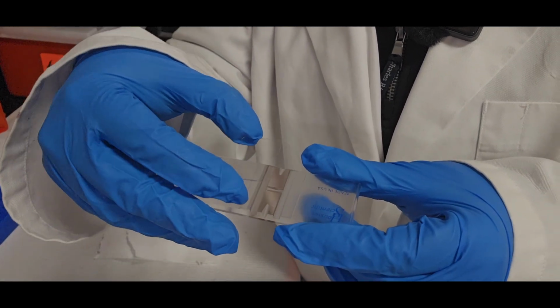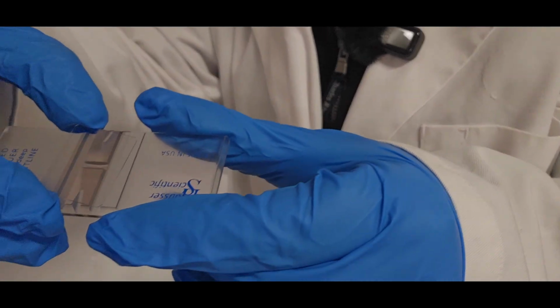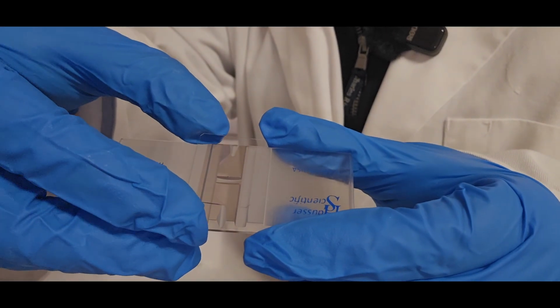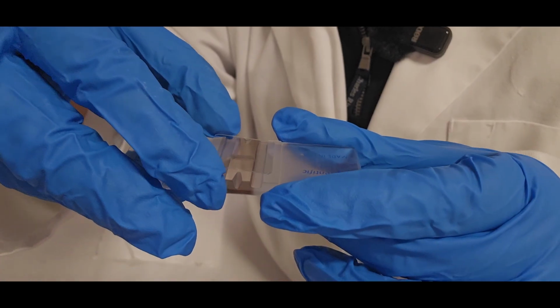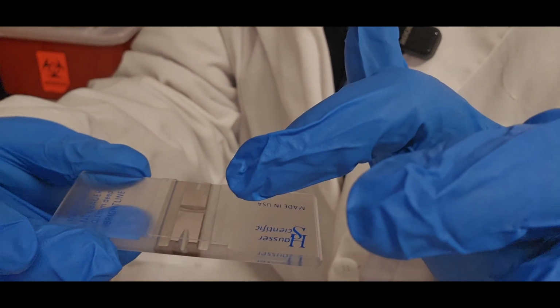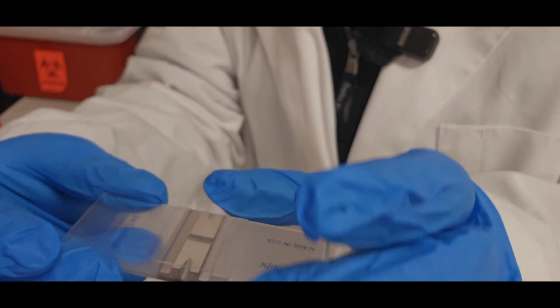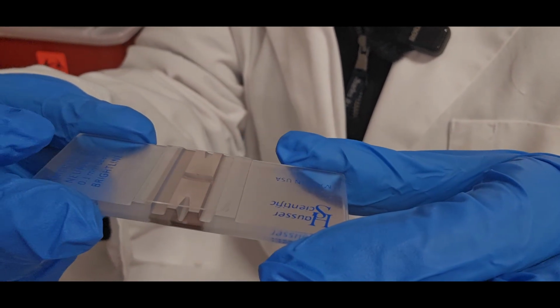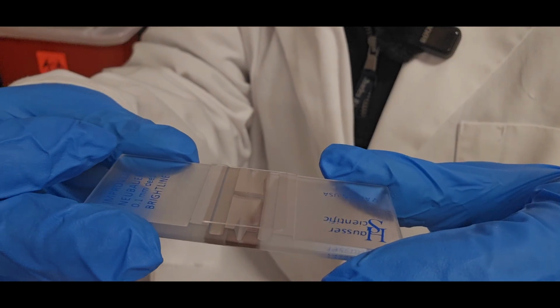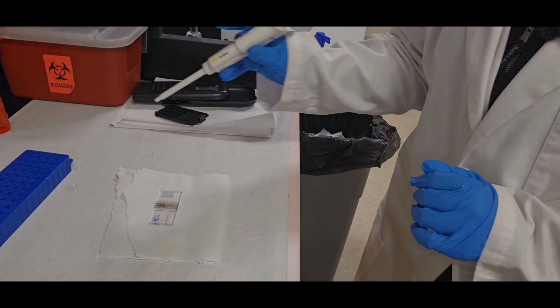This lays and aligns itself perfectly with these hemocytometers. So the long side aligns with the long slide. And you want to make it so the center of the glass slide is laying across the center of the hemocytometer here. So this is pretty straight. And now we're going to take a sample of the sample.